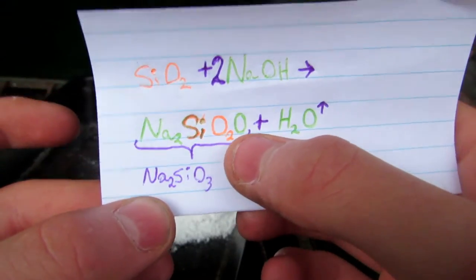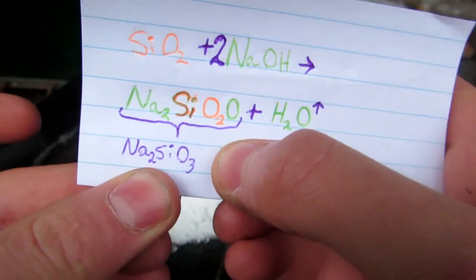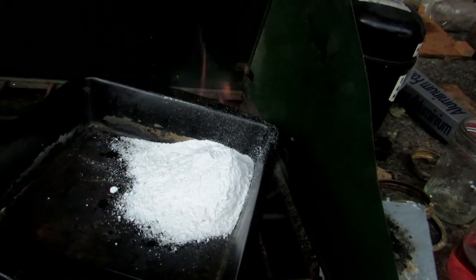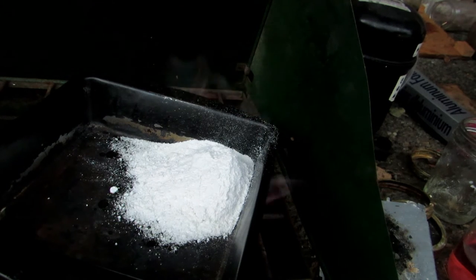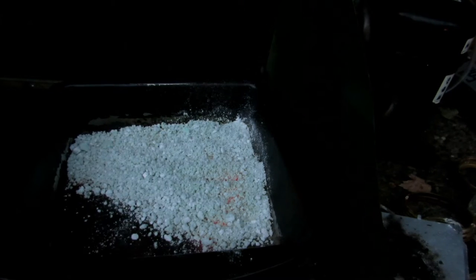I just put the other O here because it came from there, but it's simplified to this formula. We can now just go ahead and keep mixing this until it forms a nice solid chunk — this is when we will know the reaction is practically finished. After letting this go for five minutes or so, you can see it's actually started to turn green.